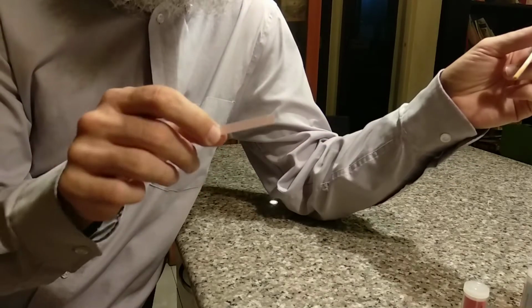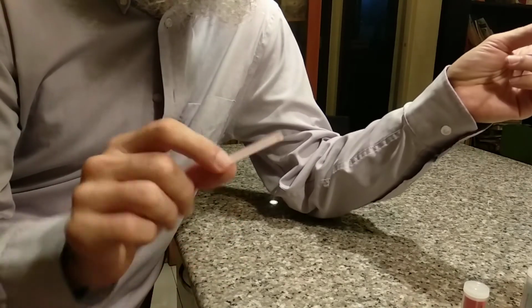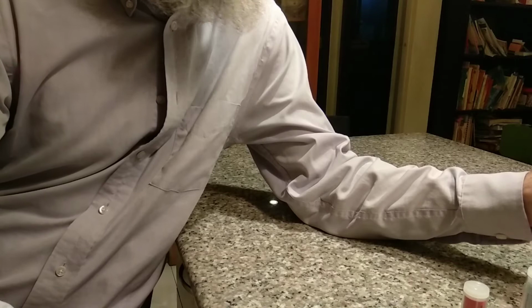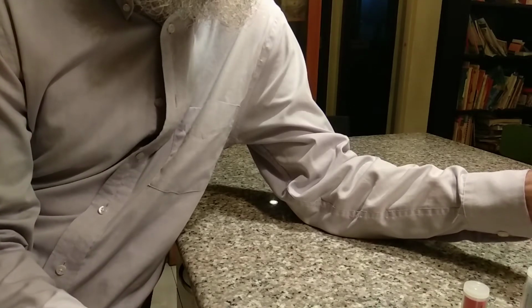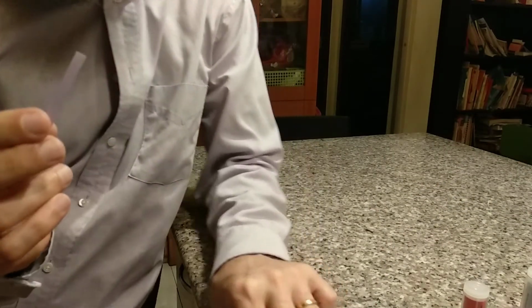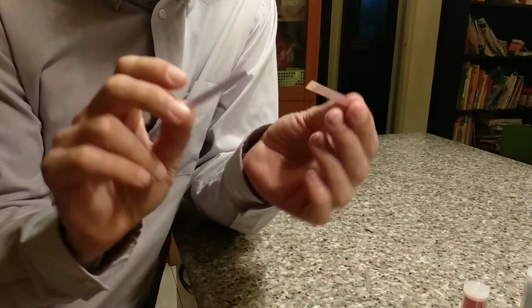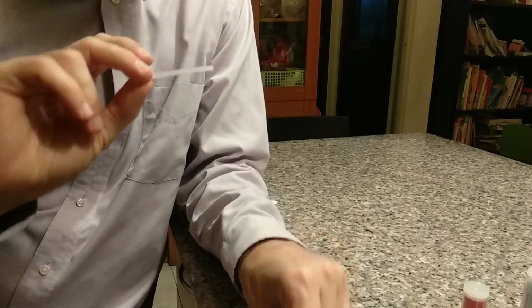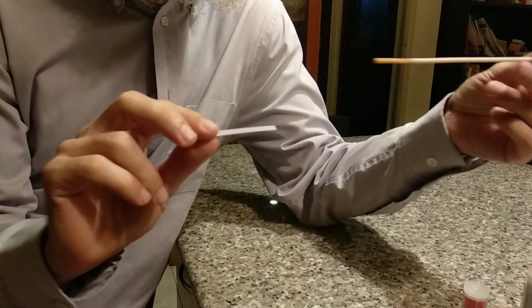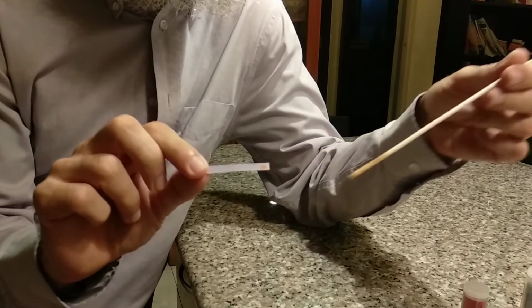Is that what you guessed? It got wet. Okay. So we see it got wet, but we don't see any change there. But litmus paper comes in two varieties: red litmus paper and blue litmus paper. If we're going to be honest, the red litmus paper is more like pink, and the blue litmus paper is more like purple. But here's my blue litmus paper. Well, we'll see. If I take that same vinegar and put it on the blue litmus paper, what's going to happen? Let me see.